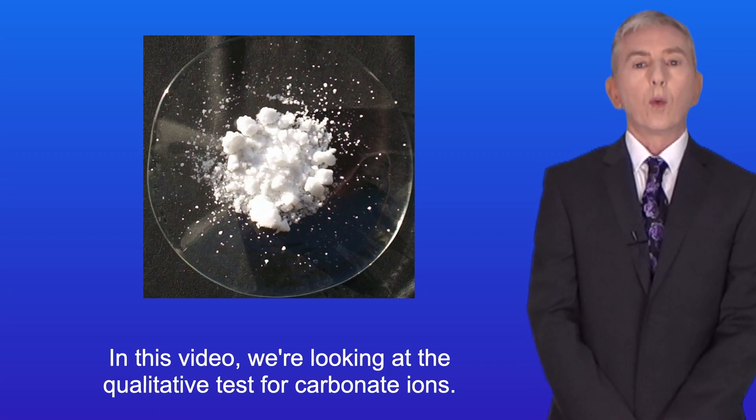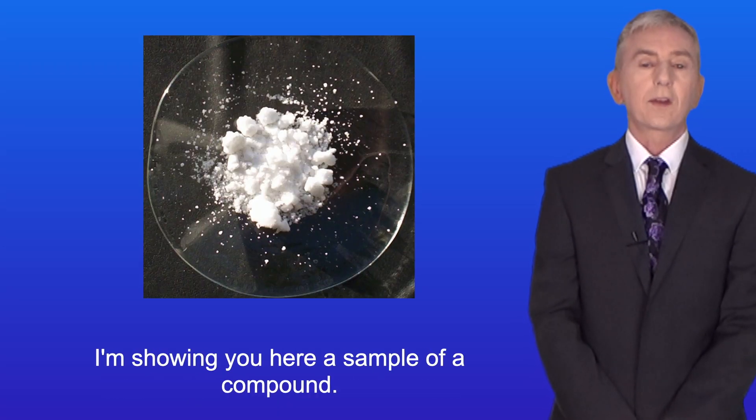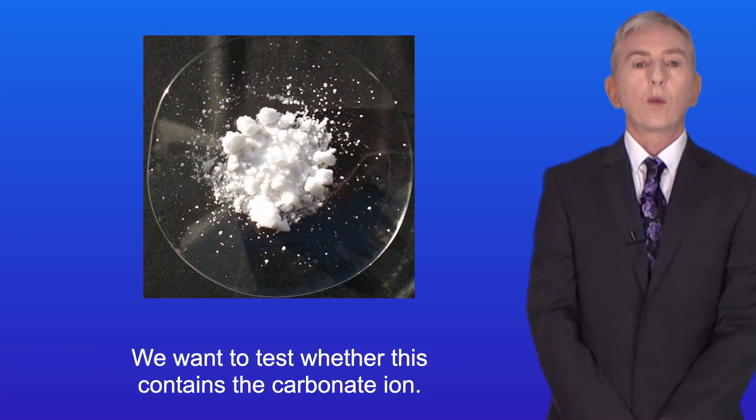In this video we're looking at the qualitative test for carbonate ions. I'm showing you here a sample of a compound and we want to test whether this contains the carbonate ion.